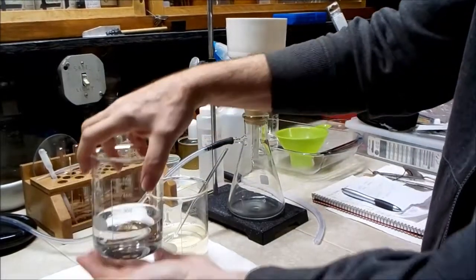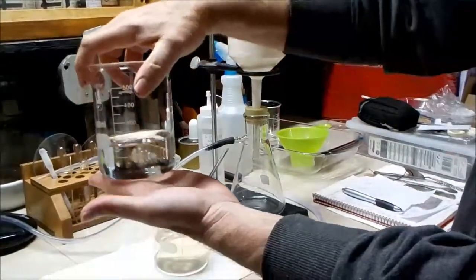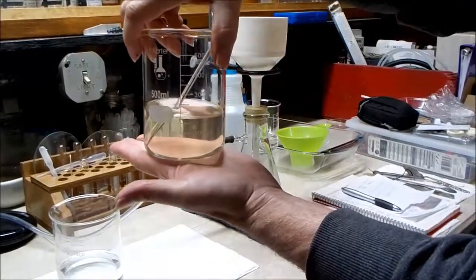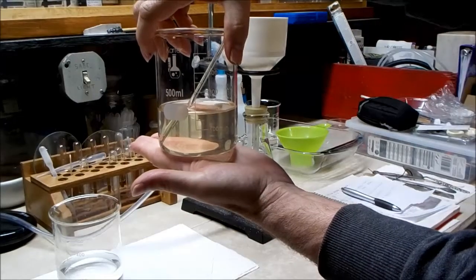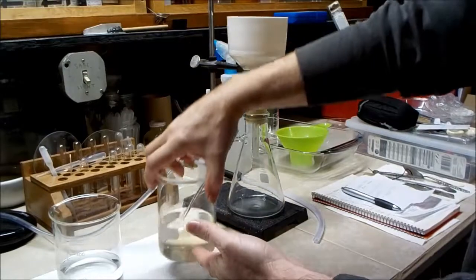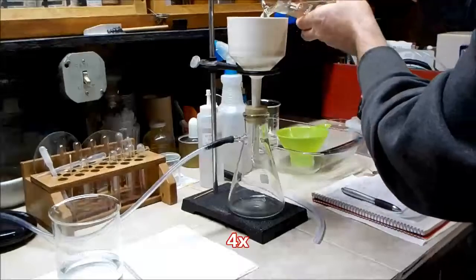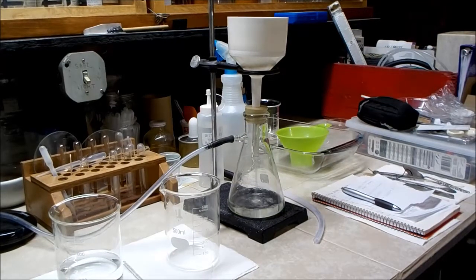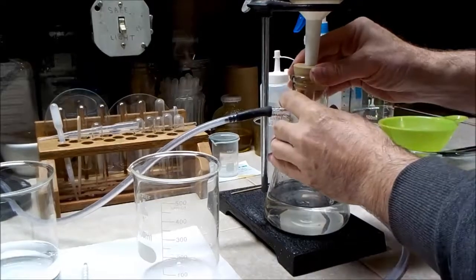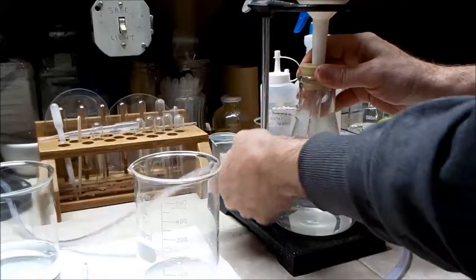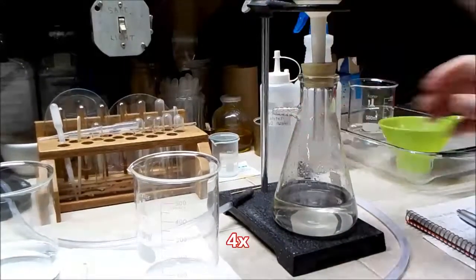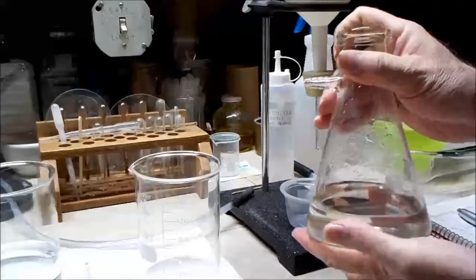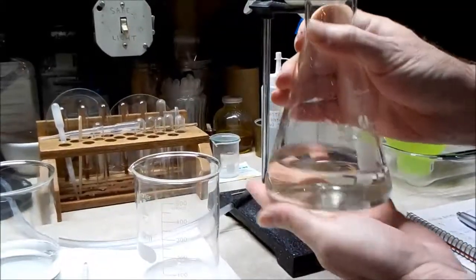So both chemicals are now dissolved. The sodium hydroxide looks nice and clear, but the calcium chloride has a little color to it, so I'm going to try and run it through the filter and see if that helps. So I would say it definitely helped. It's not perfectly clear but it's much better.